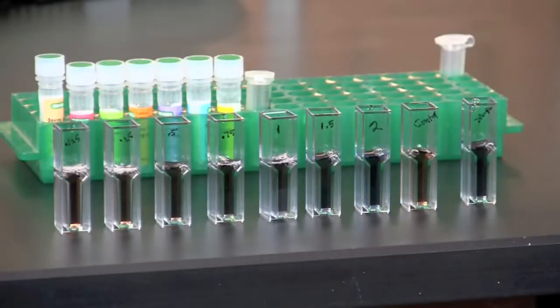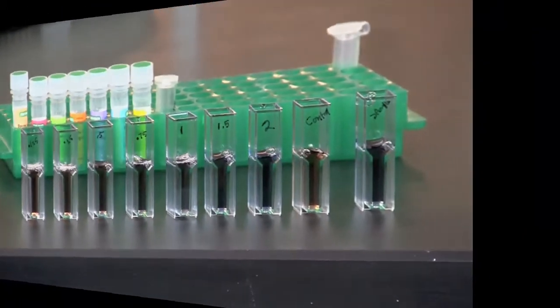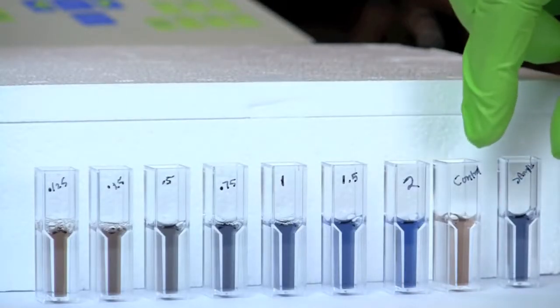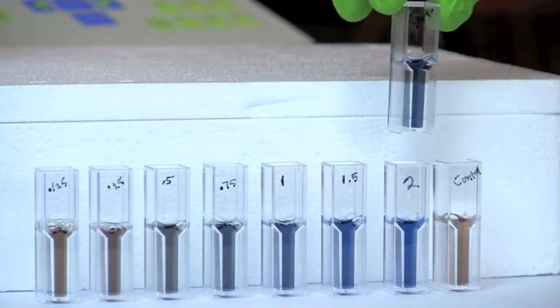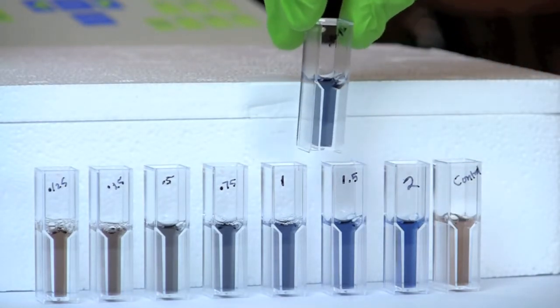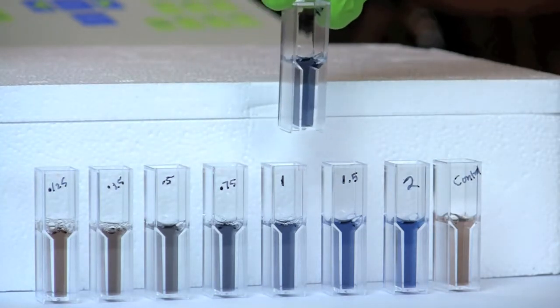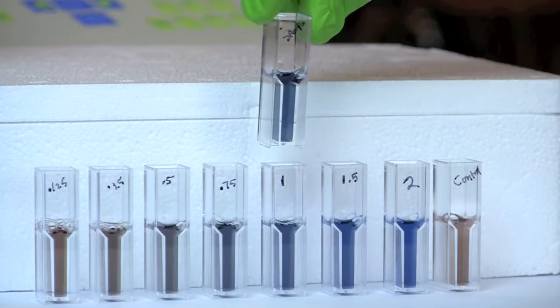Incubate the cuvettes at room temperature for 5 minutes. After 5 minutes, visually compare the cuvette containing the milk sample to the cuvettes containing the protein standards. Determine the standard that most closely matches the color of the milk sample. Estimate the protein concentration of the milk sample based upon the visual comparison.